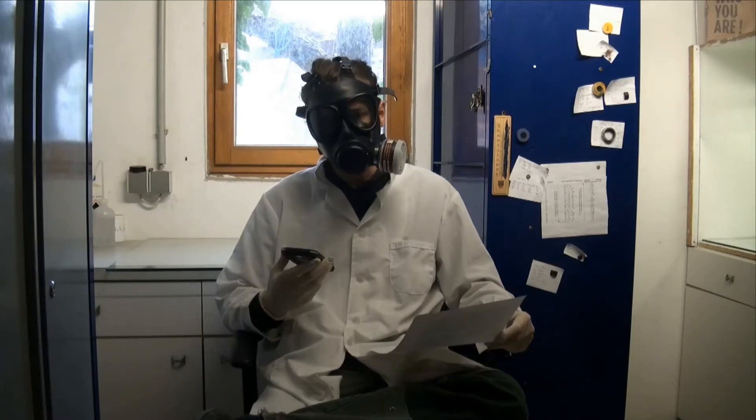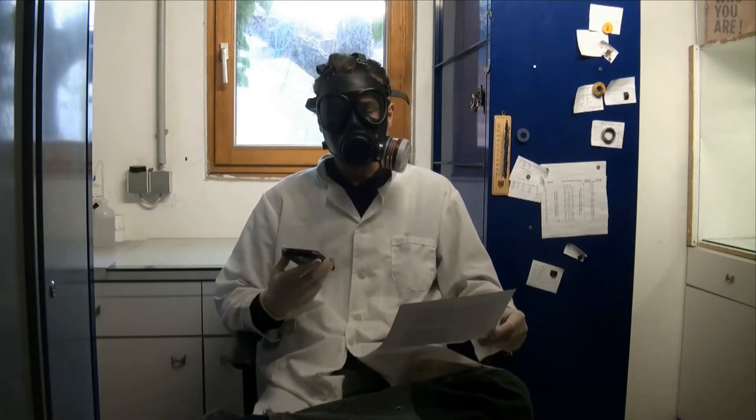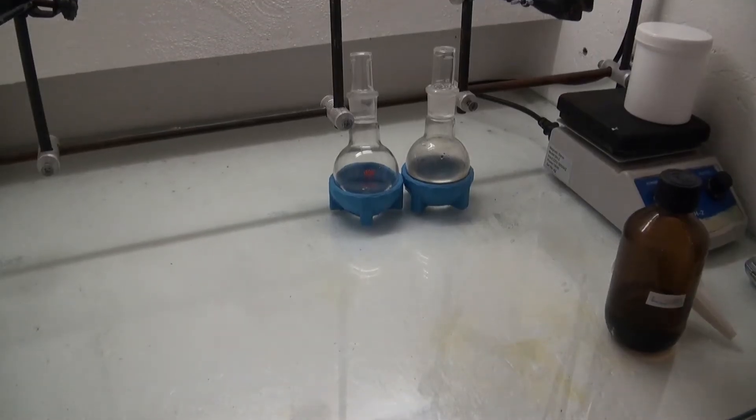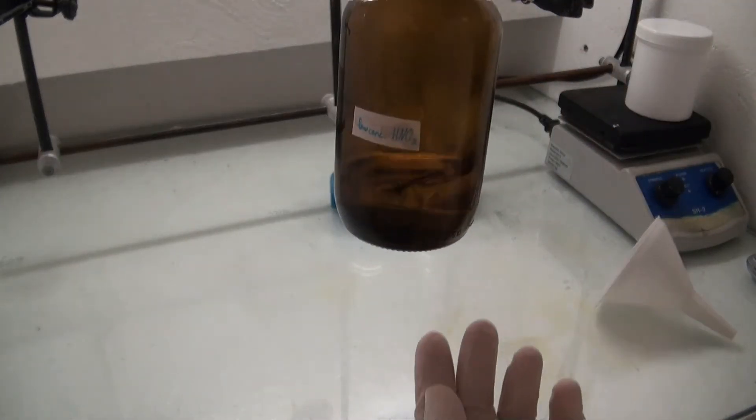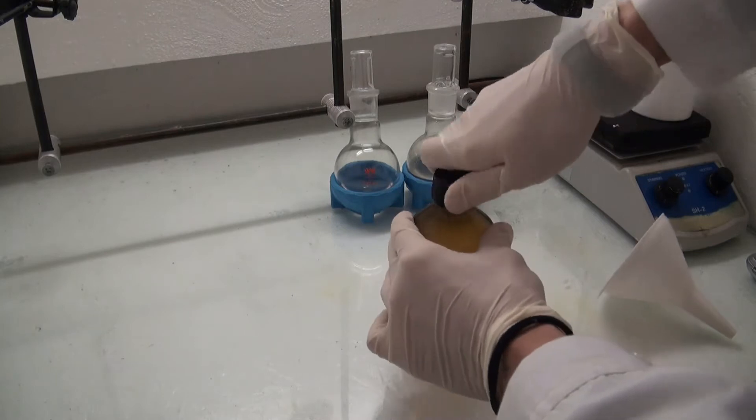This is fine for many reactions but most of the reactions I am interested in need 68% nitric acid. I added the acid from my last video into my low concentrated nitric acid flask that already had acid from other experiments in it.